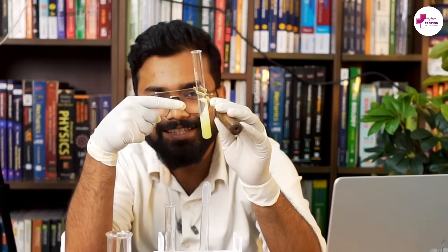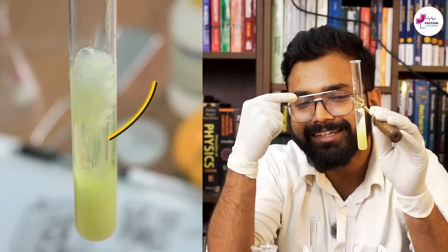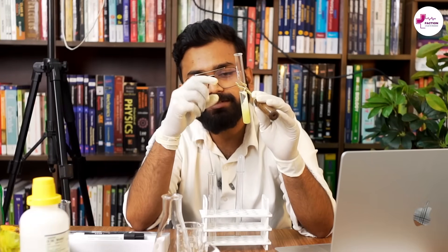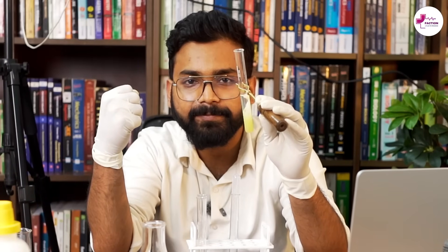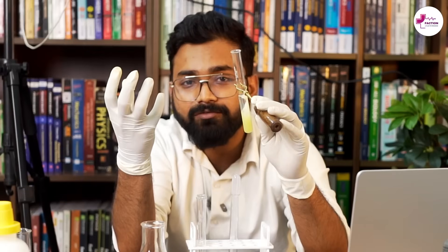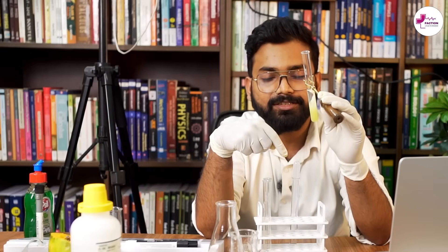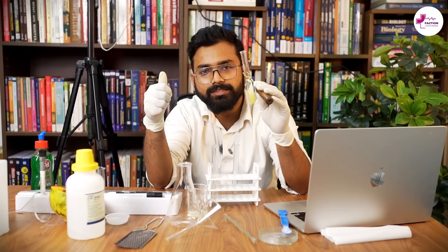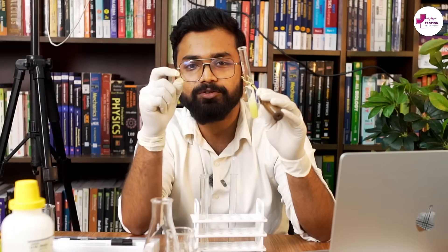You can see at the slanted interface certain fiber-like structures are visible — these are actually the DNA strands. Under a microscope you would find air bubbles and strings of DNA. If the amount of DNA were higher, it would resemble the smoke from a burning incense stick. This process of extracting DNA from the medium is called spooling — a term you may have encountered in the biotechnology chapter of class 12.